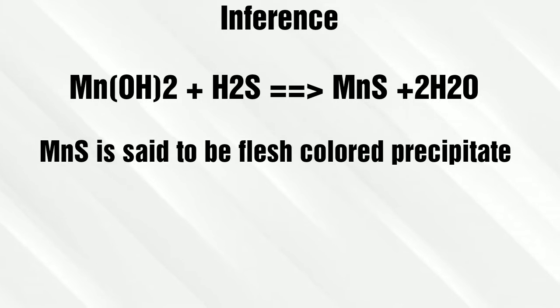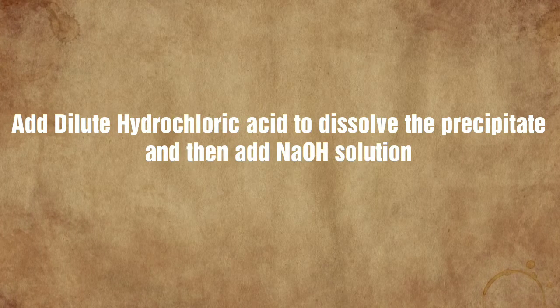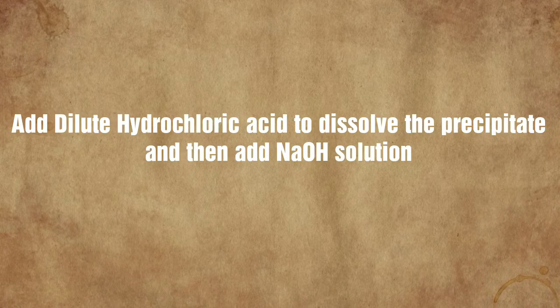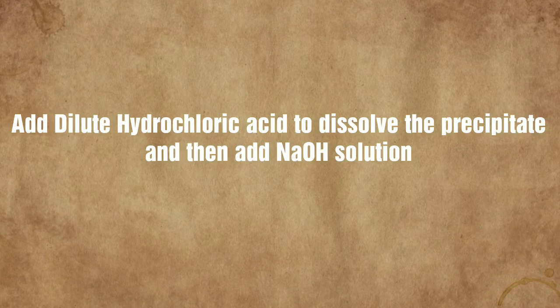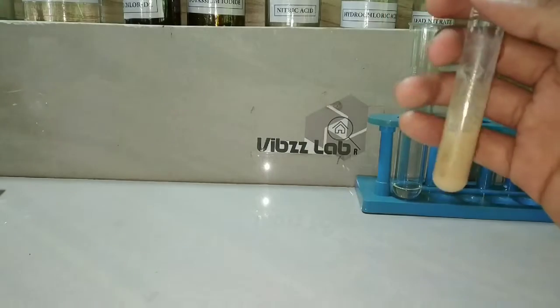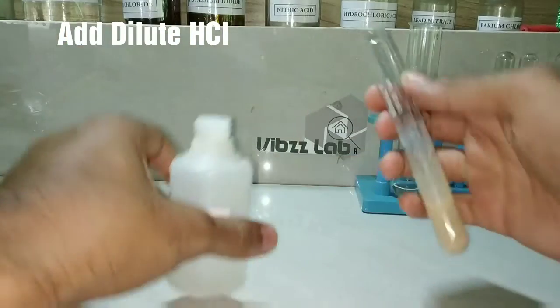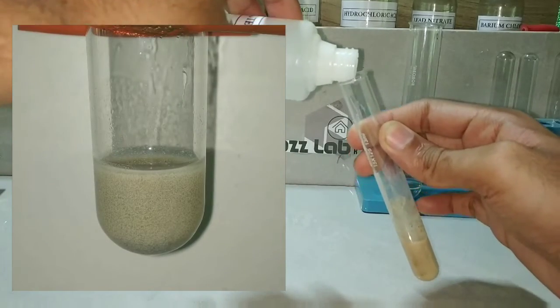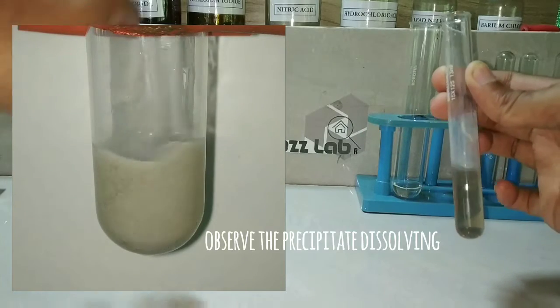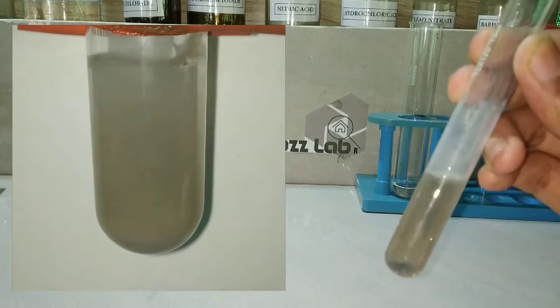The flesh-colored precipitate formed is manganese sulfide. Now we add dilute hydrochloric acid to dissolve the precipitate. We take the precipitate obtained and add dilute hydrochloric acid into it. On adding and mixing well, the precipitate has dissolved and the solution has turned clear.